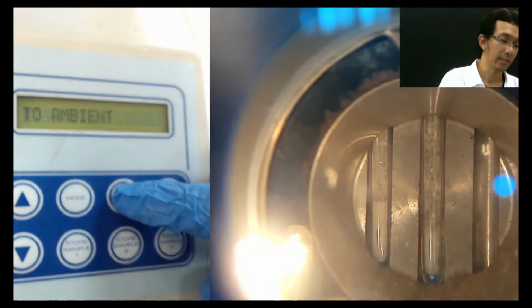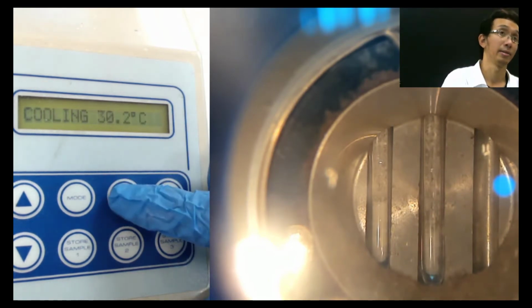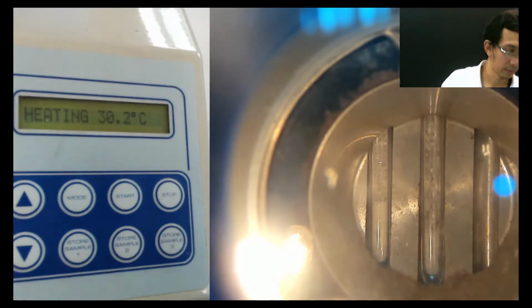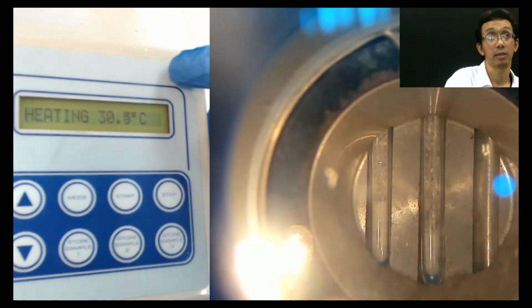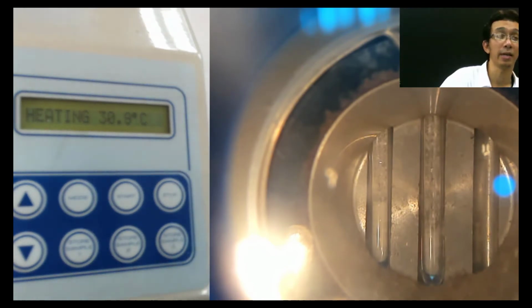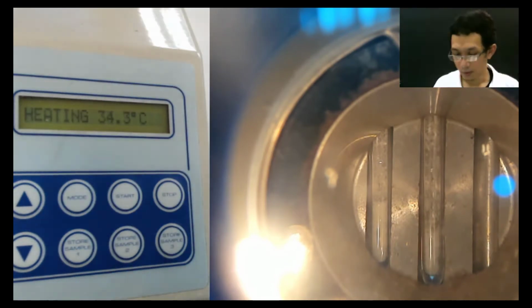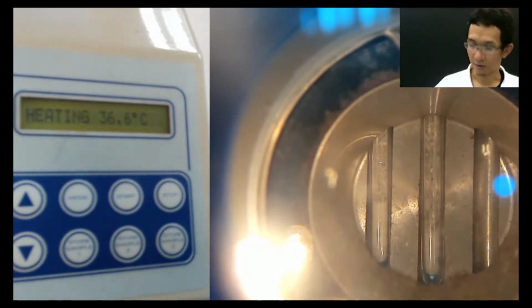Your task now is to check what is X, what is Y, the melting point for X and Y. Okay, 1, 2, 3. Okay, now it's heating. Going to the plateau is heating fast. The 5 Celsius per minute happens after you reach the plateau that is 60 that we set before. Now it goes very fast, 32, 33, 34 like that. Oh, you can still see me. Oh, there is a camera over there.